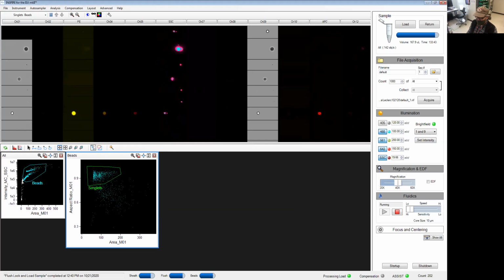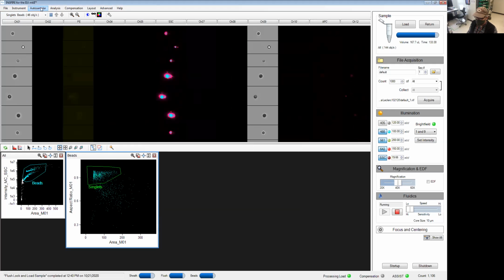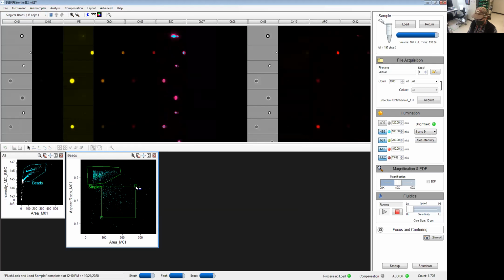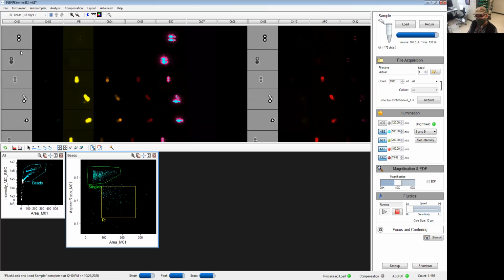Again, can go back here, make sure that all I'm doing is looking at those singlets. If you want to double check, again, R1. In R1, we should see a bunch of clumps. There you go. So these are all doublets or 4 beads and so on.